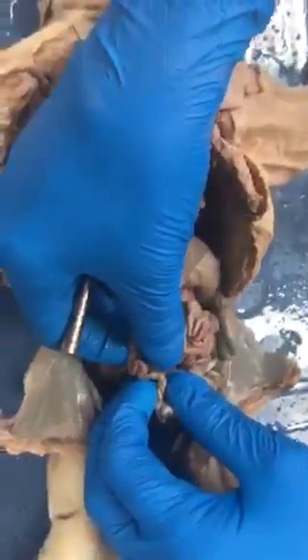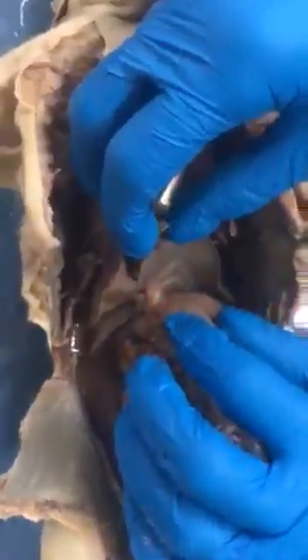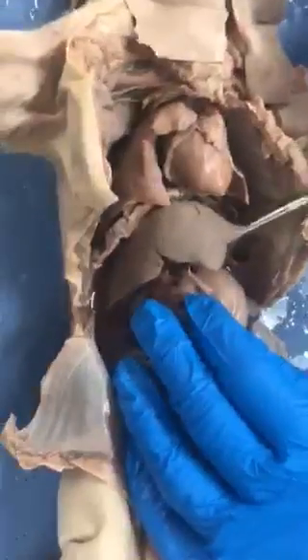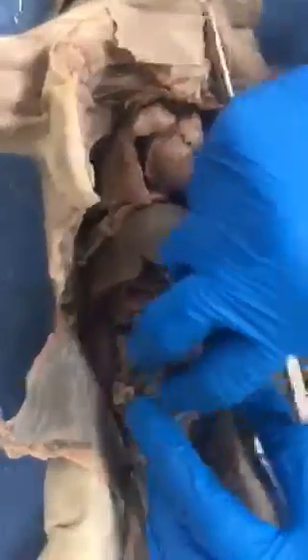So the mesentery of the small intestine is the mesentery proper, and the mesentery that runs between the underneath surface of the liver and the lesser curvature of the stomach is the same thing, visceral peritoneum coming off the liver, going down, wrapping around the stomach, and going back up the other side. That's the lesser omentum. So I'm actually going to talk about those a little more on Thursday. I haven't talked about them yet.